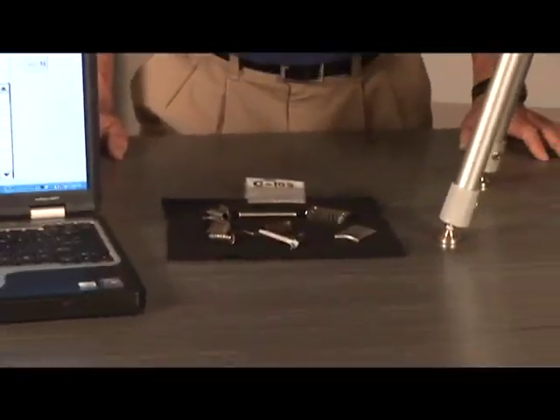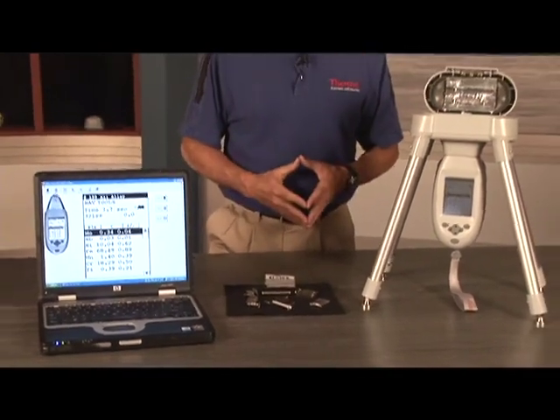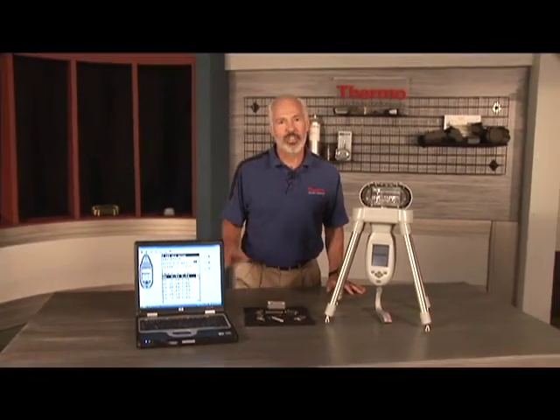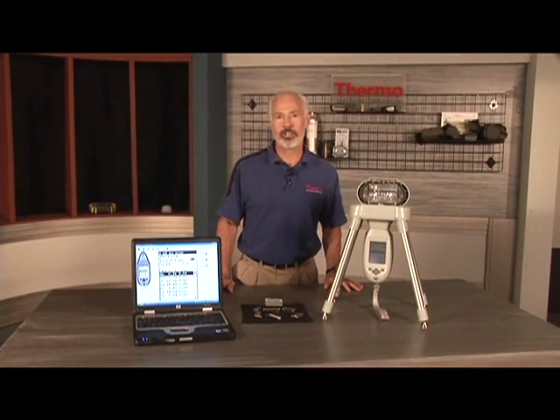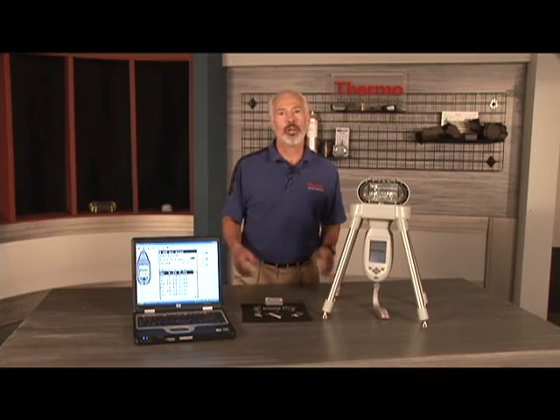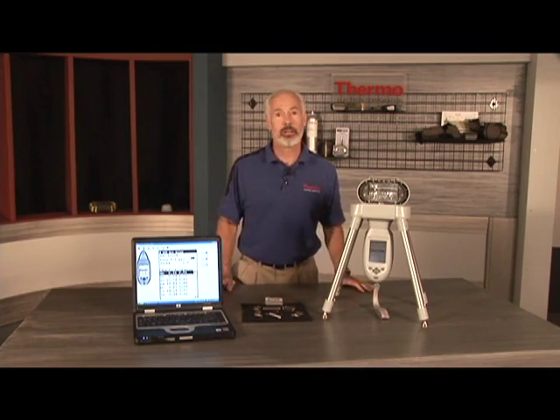Now let's take an example of the alloy recycling application. In the alloy recycling application, we may run into just about any alloy that was ever made. It's therefore typically expected that the instrument operator have good knowledge of alloys, so that interpretation of results can be accomplished when called for. With somewhere around 50,000 alloy grades in worldwide use, the scrap sorter's job can be demanding.